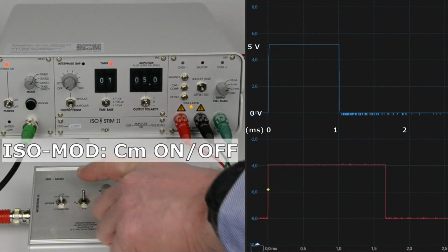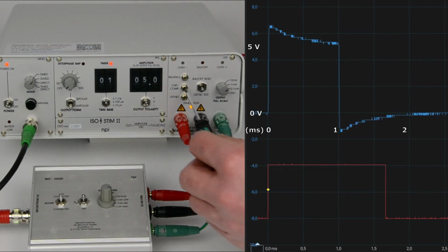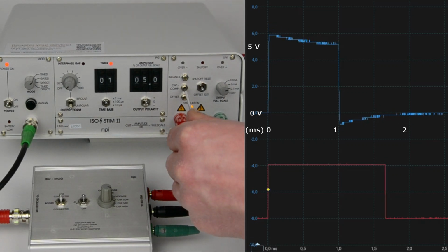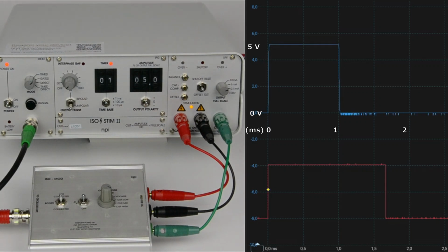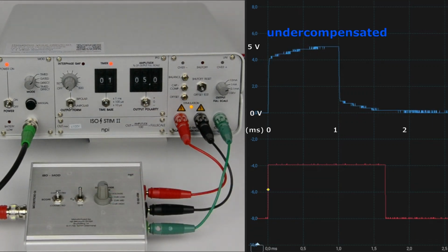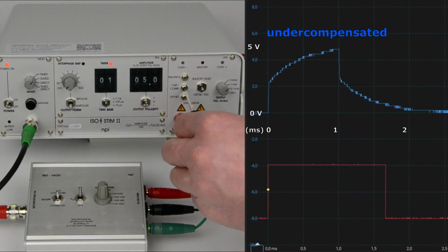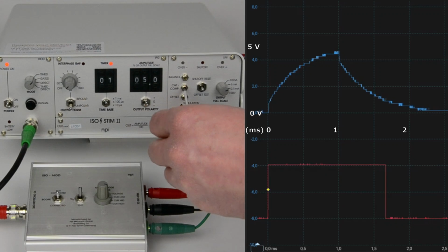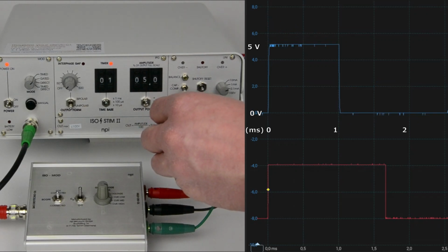Now we can play with the model cell's membrane capacitance and switch it on and off while adjusting the compensation. An undercompensated signal will look like this, and an overcompensated signal will look like this. The well-compensated signal looks like a square.